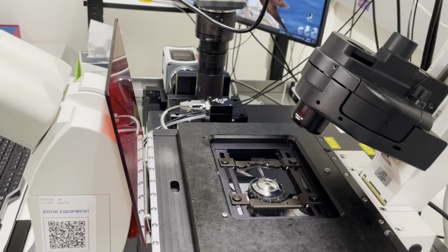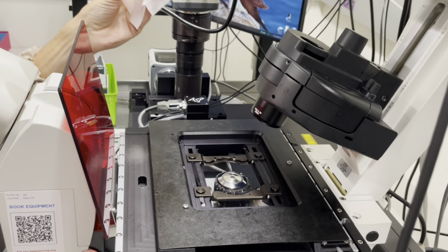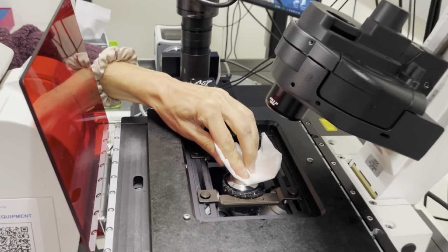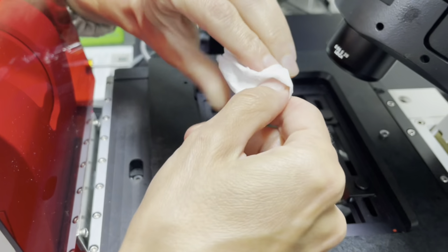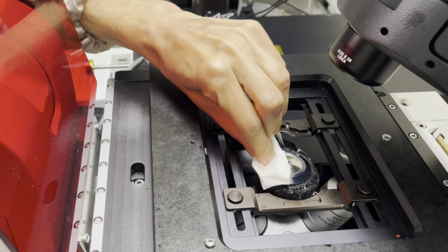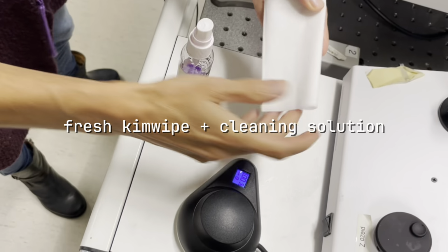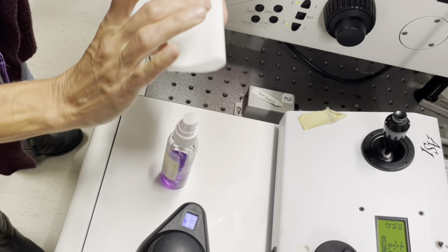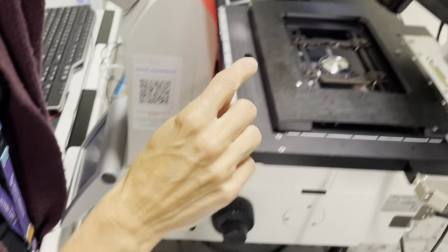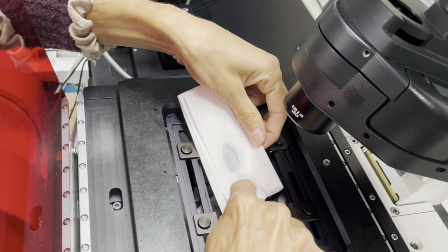Take a dry Kim wipe and remove as much excess oil as possible. Never reuse the same part of the Kim wipe more than once, and just throw them out. Then you'll take a fresh Kim wipe and use the cleaning solution provided. All of these supplies will always be available for you. Start in the center and with circular motions make bigger and bigger circles.